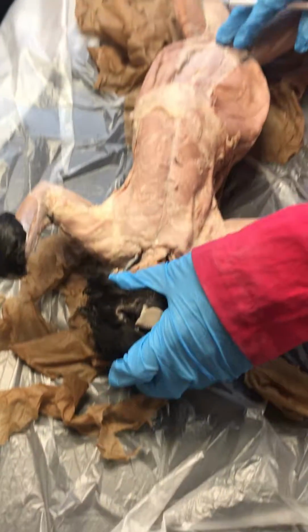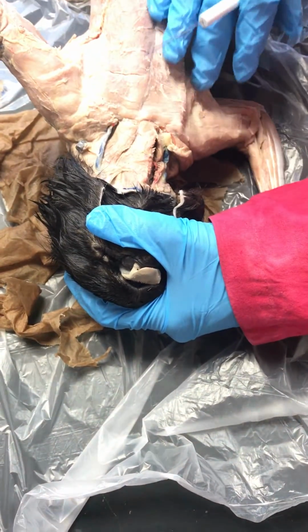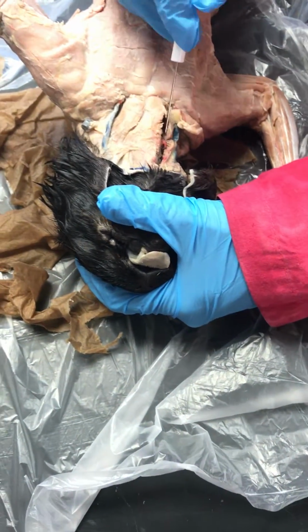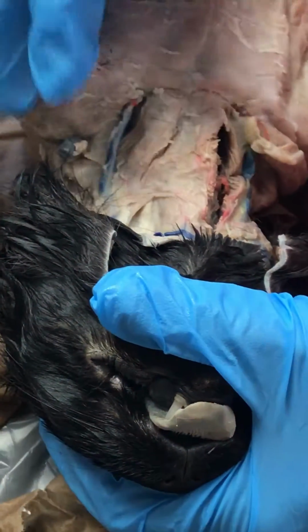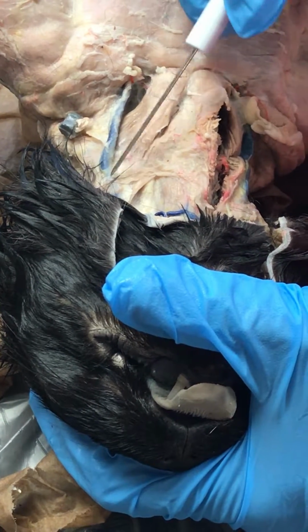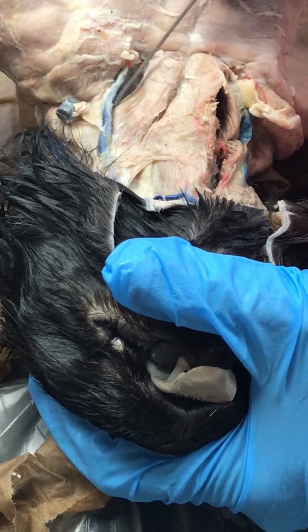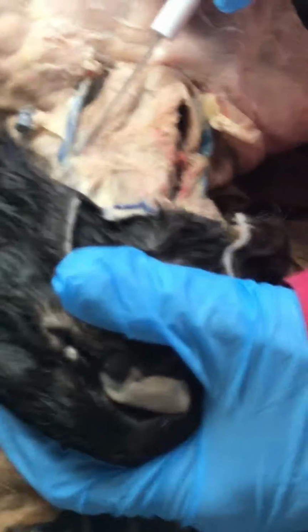Okay, it's going to be a little bit difficult in the neck region because of the way they prepare the cat and the way they cut it. Some of you guys really struggled finding the sternomastoid. The sternomastoid on this cat is right here. This big, huge vessel is the jugular vein. It's one of your biggest ones, okay?